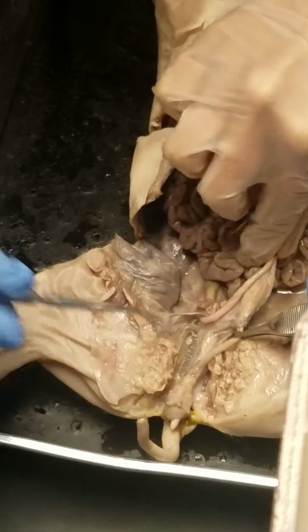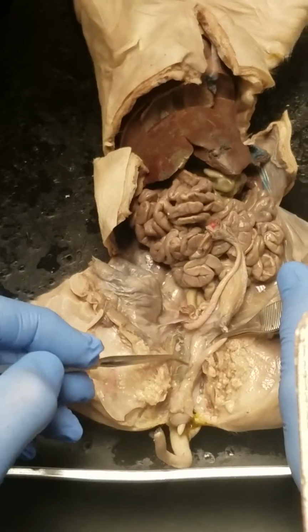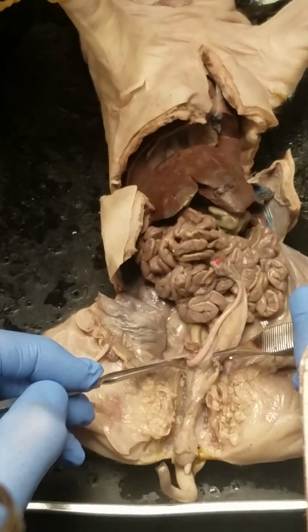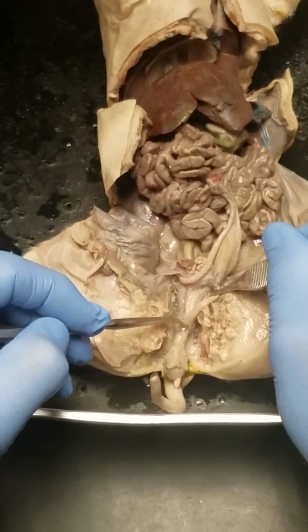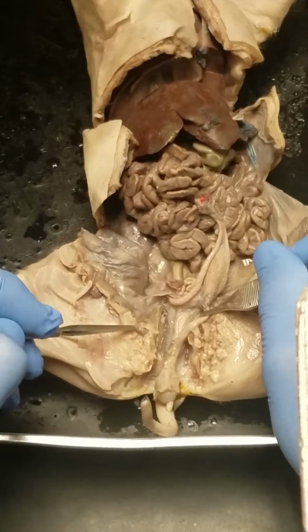Now, obviously, when this pig goes through puberty, this tube will stay relatively small, and this tube will get much bigger. So some of you guys are going, they look the same. But that's what will happen. In the vestibule? From here forward. So after the Y connects on down. Okay. So in other words, this is a common path for urine and vaginal functions.